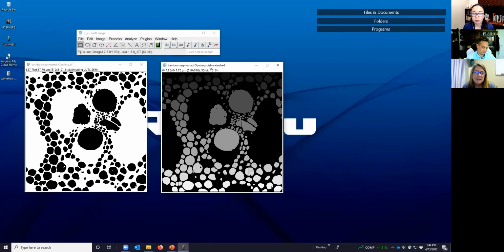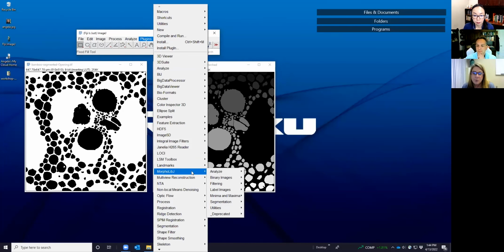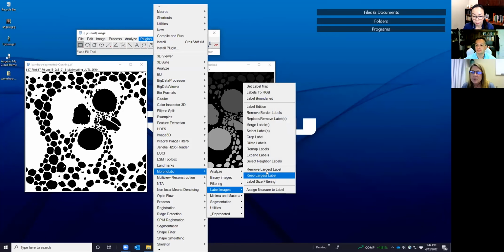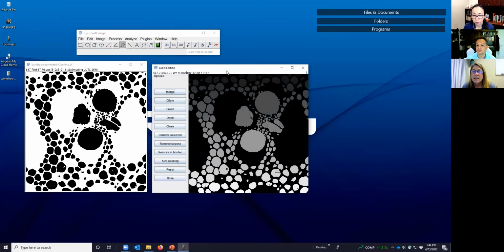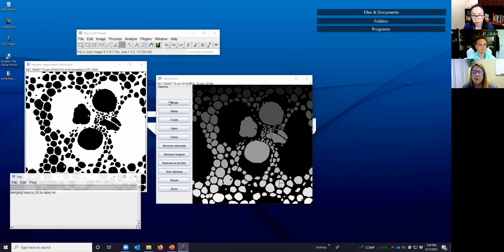So how do we fix that? Well, that's easy to do, and there's a tool for that in MorphoLibJ. If you go to MorphoLibJ, label images and label edition, you'll get a new window. What we'll see here is some tools on the left that allow us to merge these over-segmented items. It's simple to do. You just click on the two that you want to merge, click merge, and you'll see a log window that says it's merging 50 and 44.